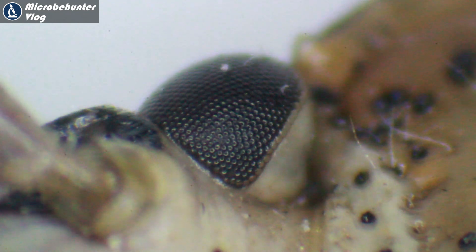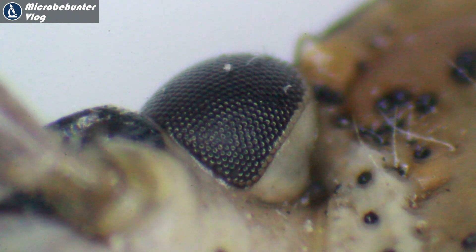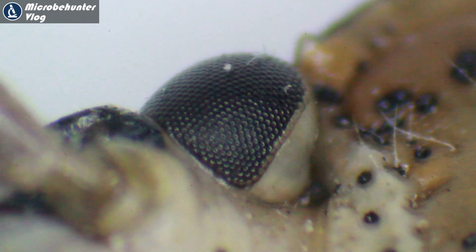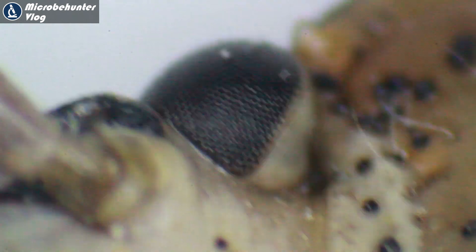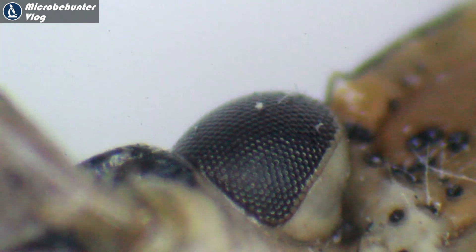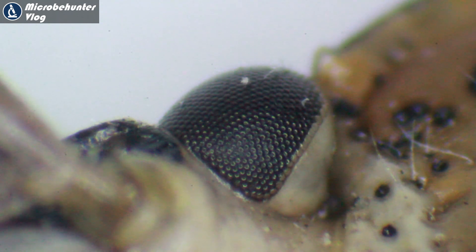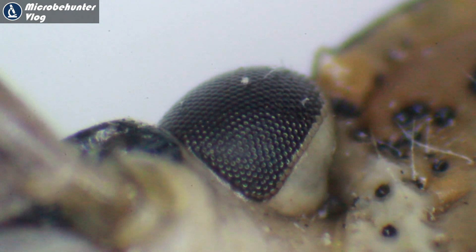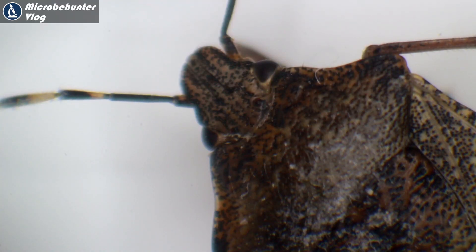That's the compound eye — something that pretty much all insects have. Bugs and beetles are similar in that respect. I'm focusing back and forth to show the three-dimensional nature of the eye.